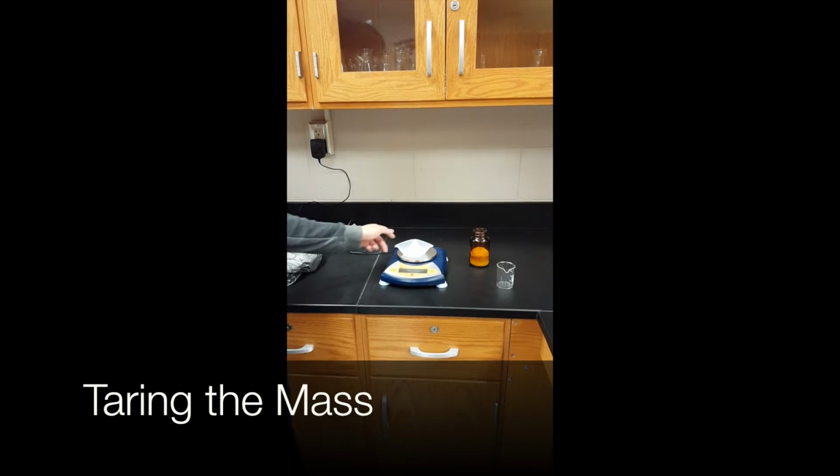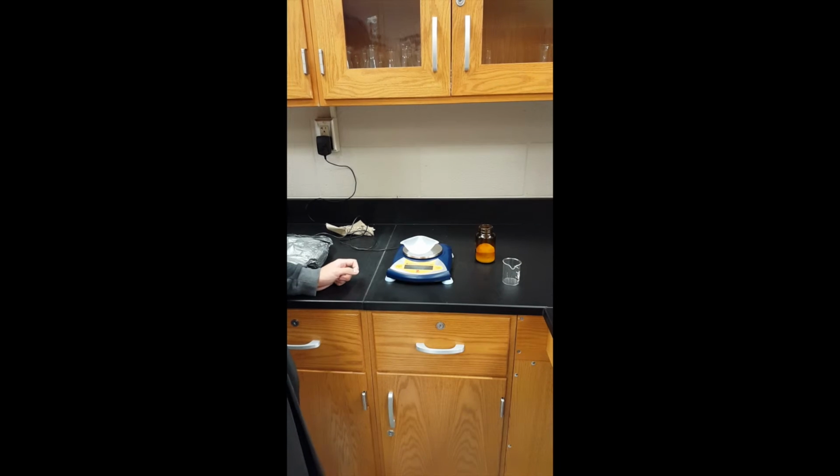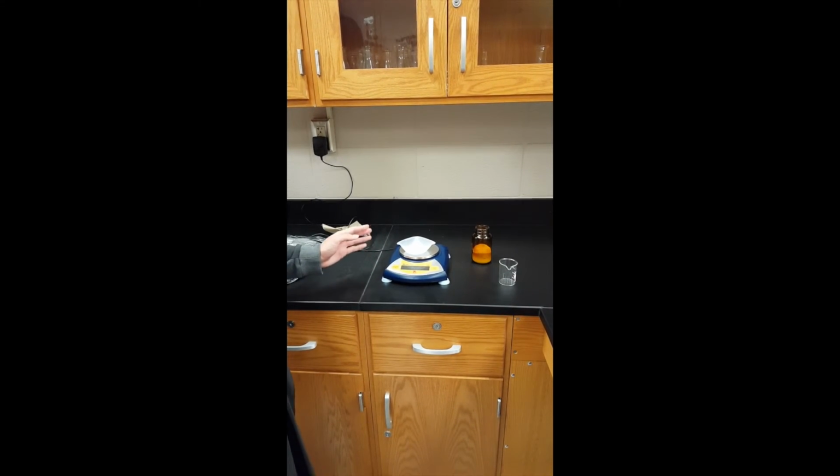Like the other balance, we will need to use the plastic weight boat to hold our sample. To adjust for the mass of the weight boat, simply press the on button again while the empty weight boat is on the balance. This zeroes the reading and allows you to tare the mass of your sample.